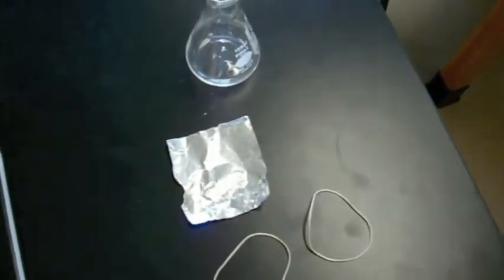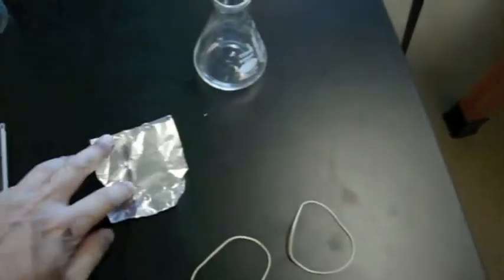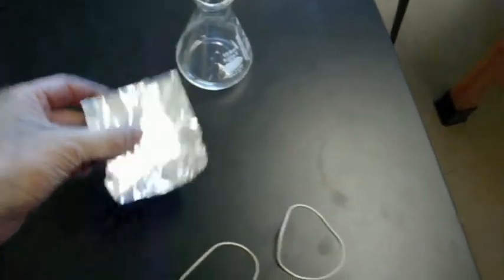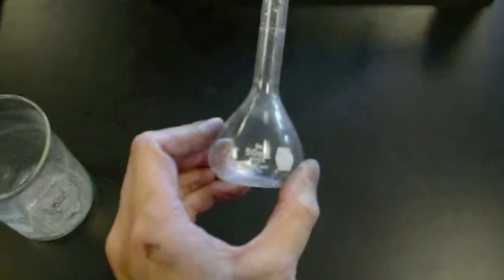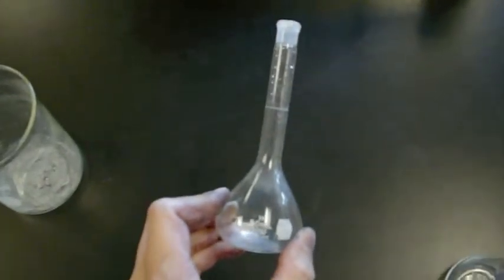And then your actual Dumas tube will be made out of these four items: the piece of aluminum foil, about two inches to a side, two rubber bands, and a 125 milliliter Erlenmeyer flask. You'll also need a 50 milliliter volumetric flask.